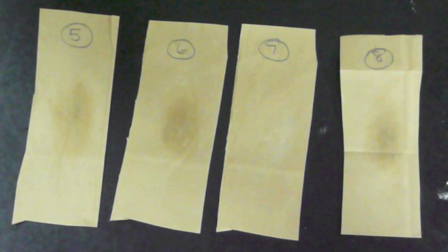Once again, as we flip each bag, do your observations, decide on your test results, and then do your post lab questions.